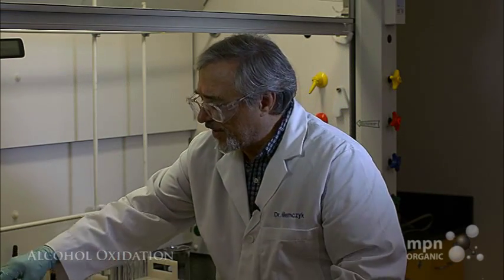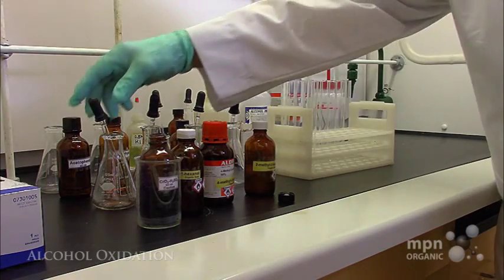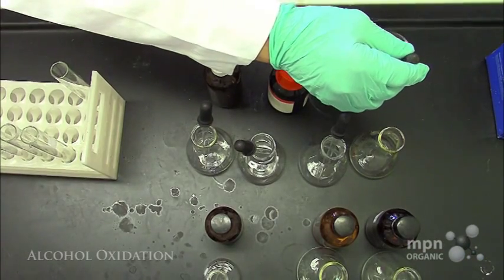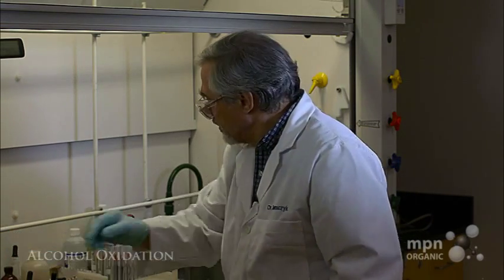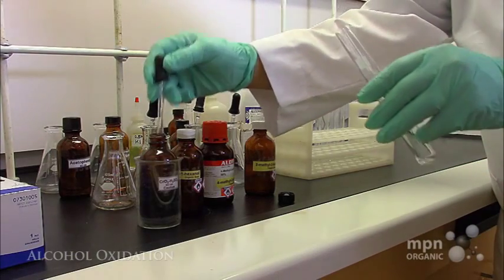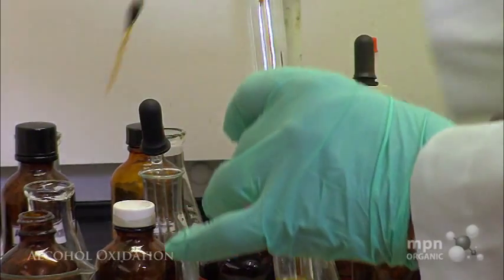All right, and we're going to then take the chromium trioxide and sulfuric acid. And you'll see this is a very dark orange-brown reagent. You can see that in the dropper, an orange-brown reagent. Okay, let's take our solution. Now this is 1-hexanol, and let's add the reagent.